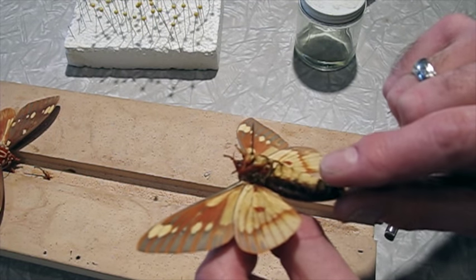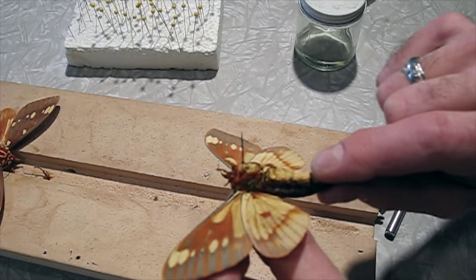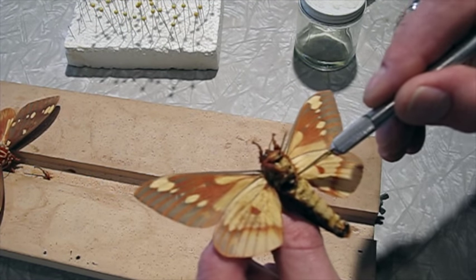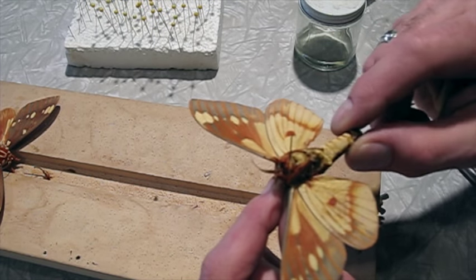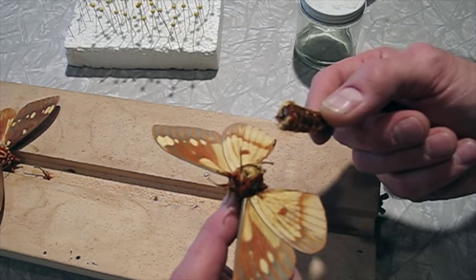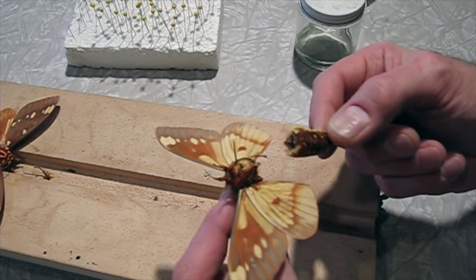And I'm going to grab the tip and bend it backwards. There it comes — it's going to work just fine. It's got a little piece joining there yet. Sometimes these larger moths, when they're shipped as specimens, they remove the abdomen and ship it separately, and soak it in acetone ahead of time so that it doesn't stain the wings.